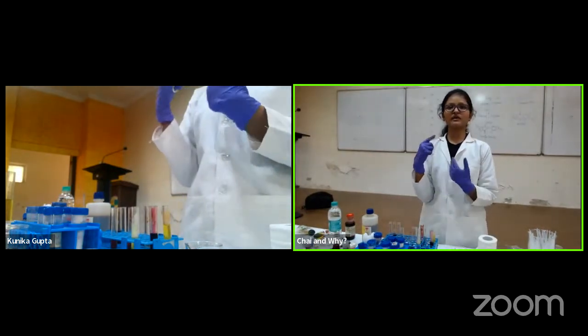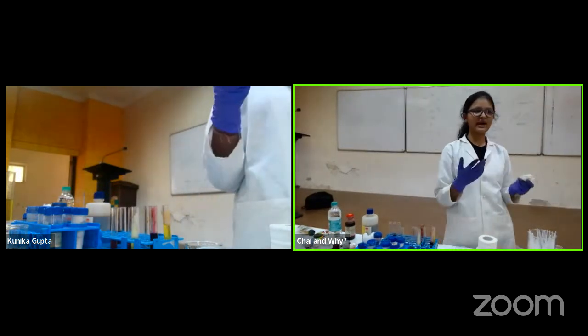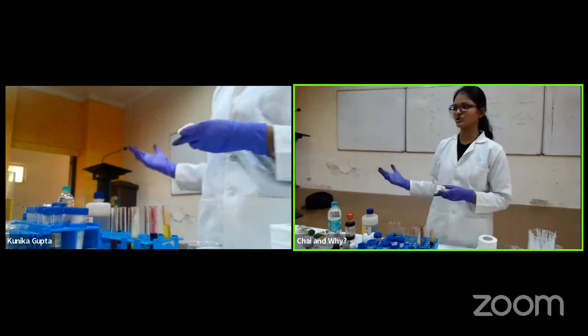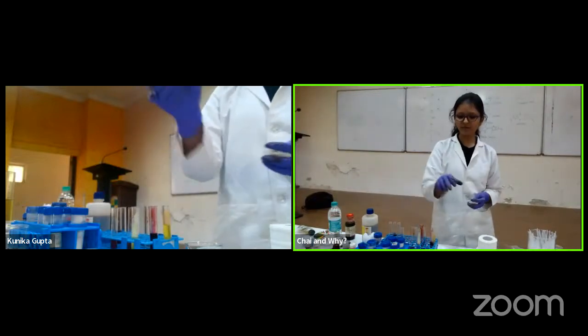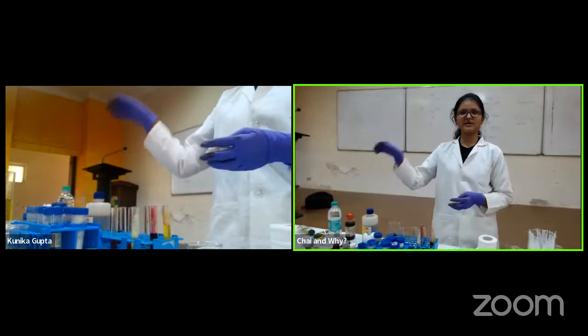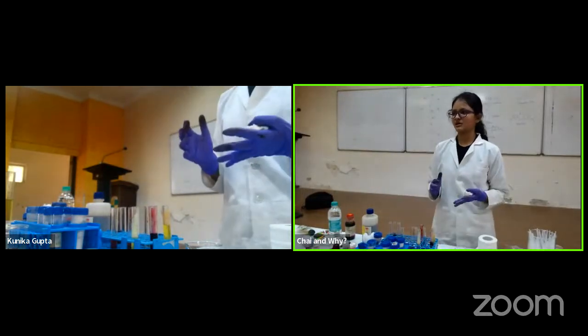So if you want to see what a dry setup looks like, go to the previous Holi session that we did from the lab. So we are showing you the exact sequence of experiments. Okay, so the dye is formed. Now I have to take it out of this mixture, because you see I have added pyrrole, something in between, acids, and bases. So my molecule is with all of them. I want it separate, so I have to purify it.